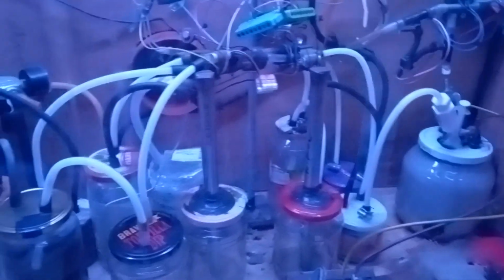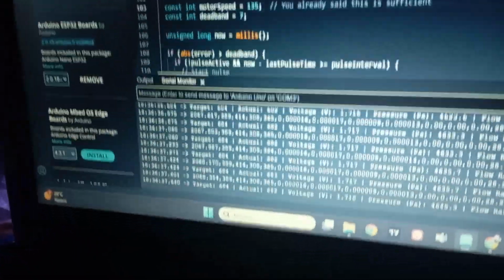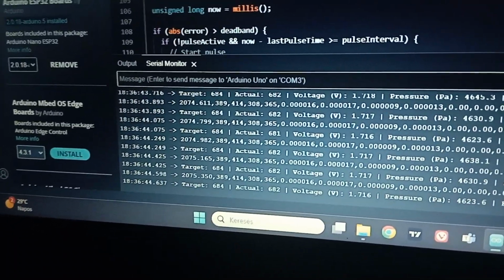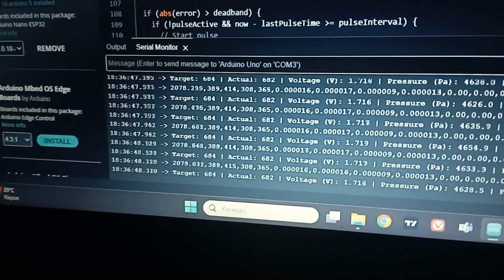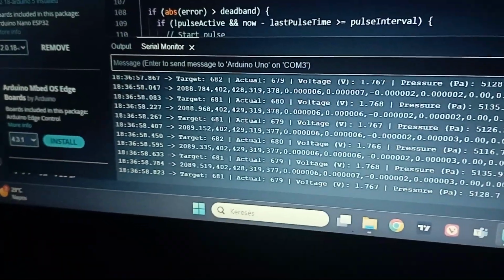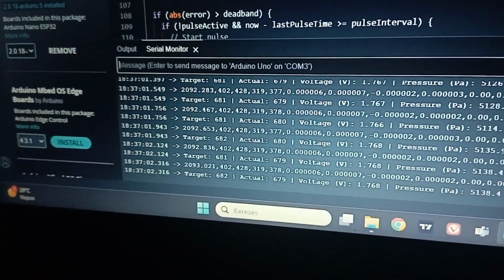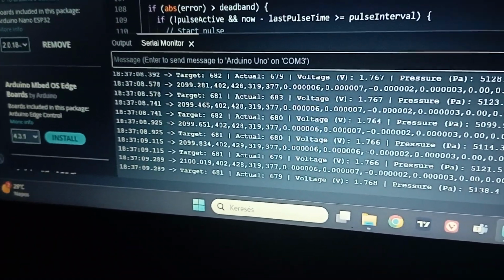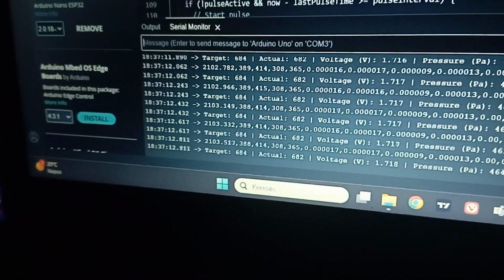For now I'm not heating the catalyst chambers. I'm just seeing the data. You want to catch the line which is 414, 308, 365, that line. So 389, 414, so we are increasing. It was around that, now it is 402. And basically we went up from 389 to that point, and we are not burning, or if we are burning, we are not burning that much.